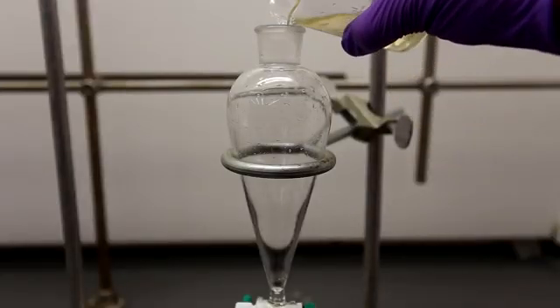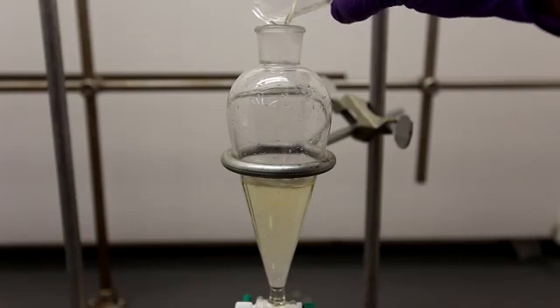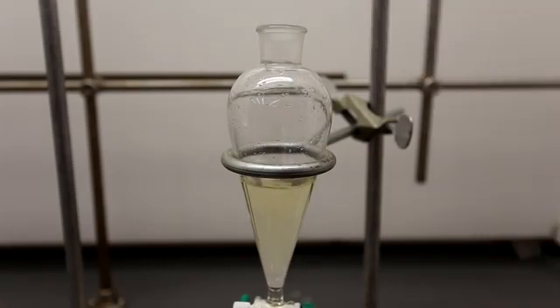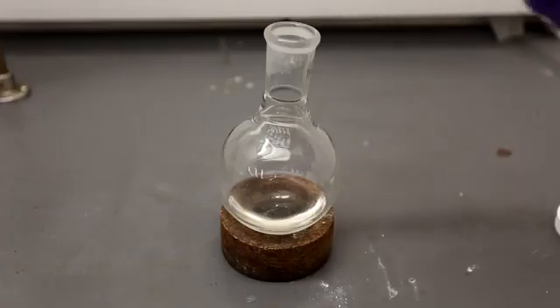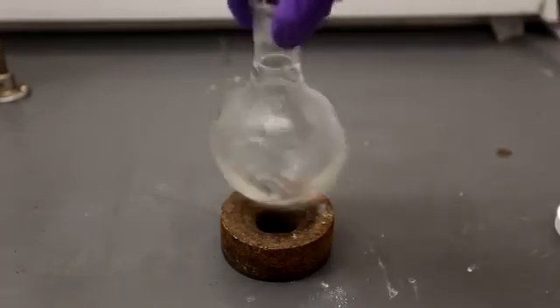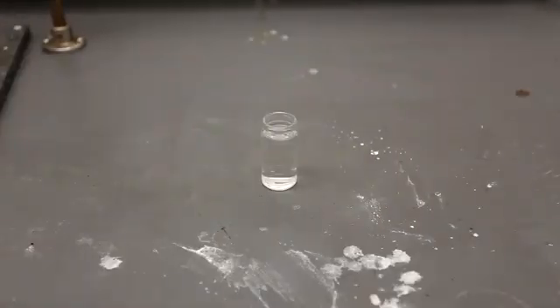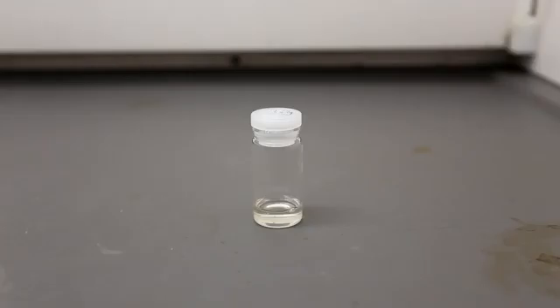The aqueous layer was transferred back to the separatory funnel and it was further extracted 5 times with 5 milliliters of ether each time. The ether washings collected in the round bottom flask were then dried using a minimal amount of magnesium sulfate. The ether butyric acid solution was transferred to a dram vial and allowed to evaporate. The final yield was 3.75 milliliters of butyric acid, which represents a yield of about 60%.